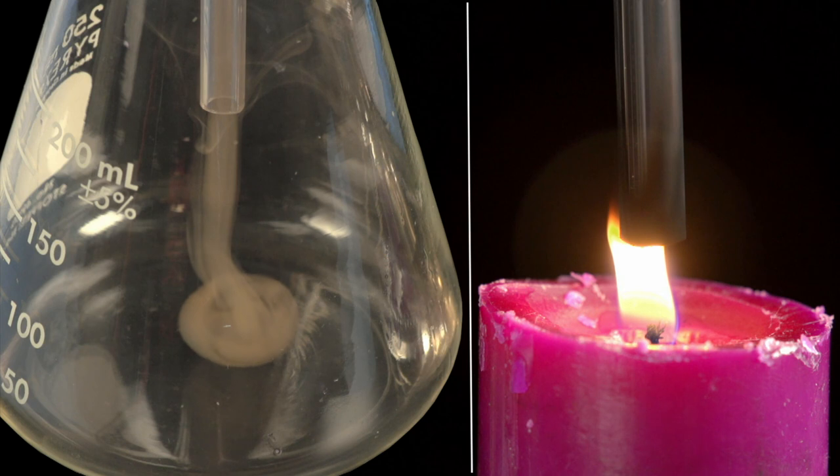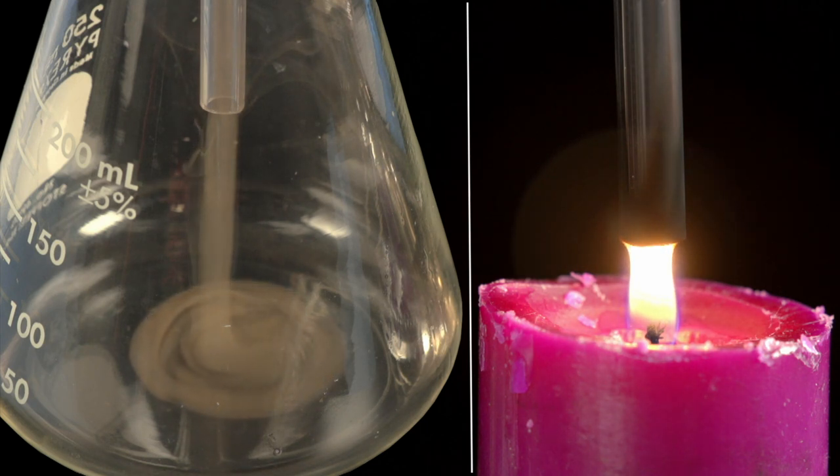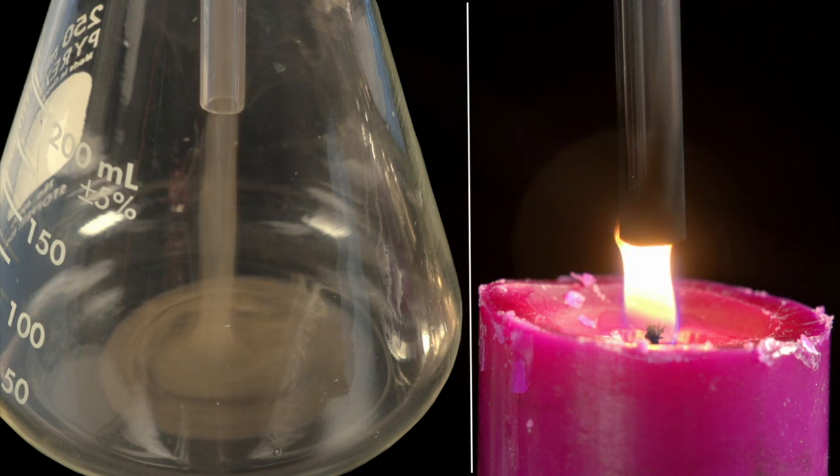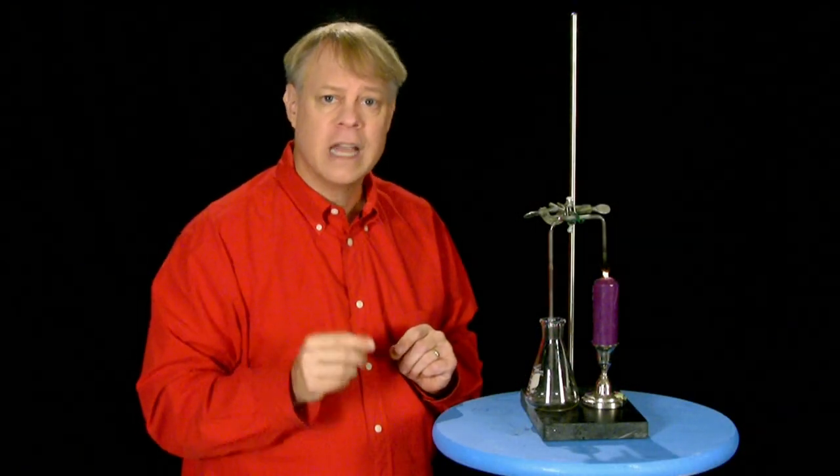It not only escapes from the end of the tube, but falls down to the bottom of the flask like a heavy substance, as indeed it is. We find that it is the wax of the candle made into a vaporous fluid, not a gas.